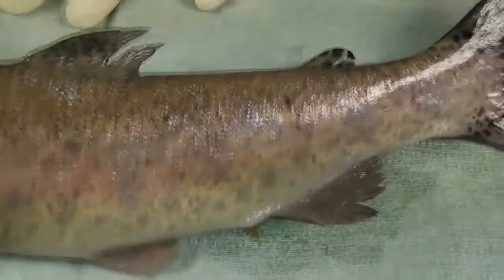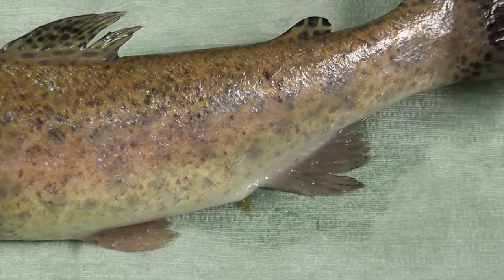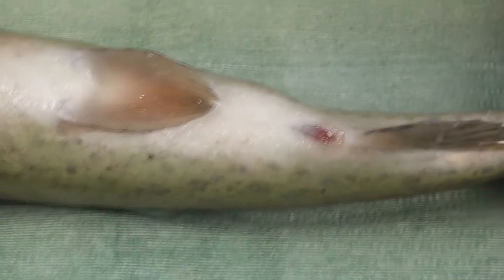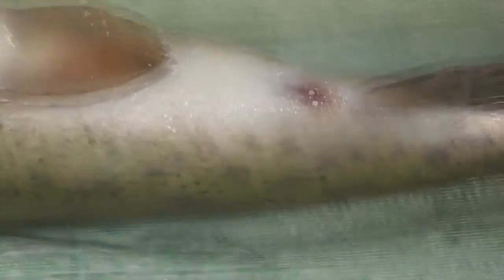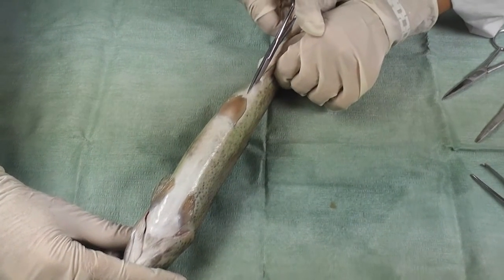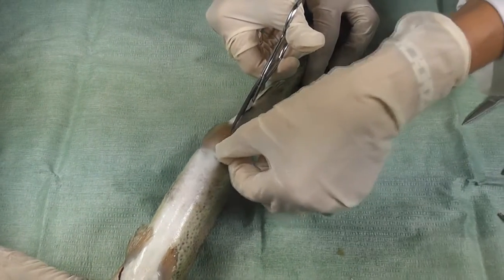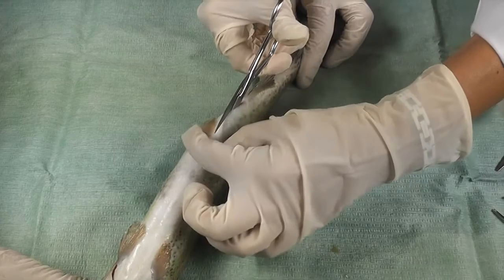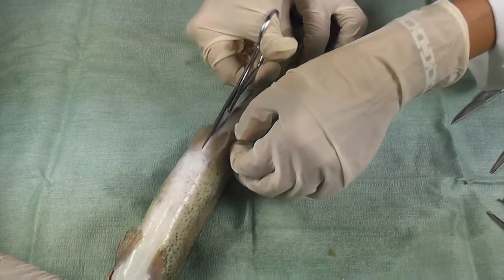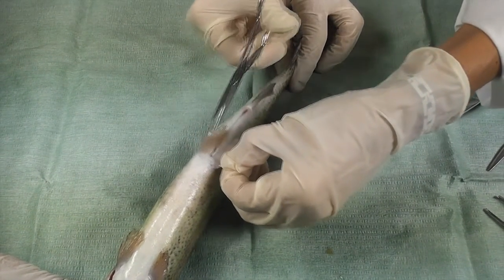Now we can observe in the ventral portion of the fish the presence of the vent. We are ready to cut the trout open, beginning at the vent, and we can open the fish from the vent to the throat. But do not cut too deeply or the internal organs will be damaged.